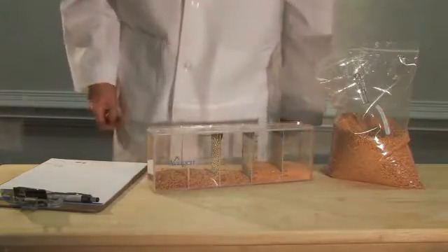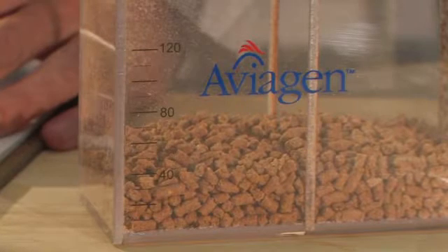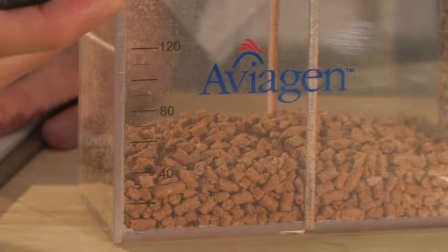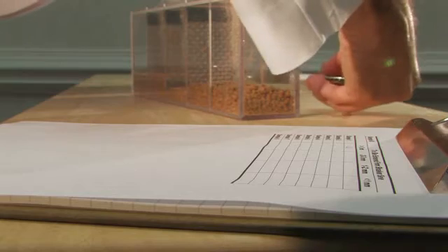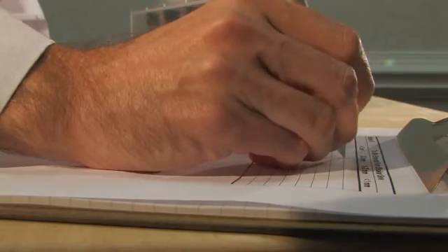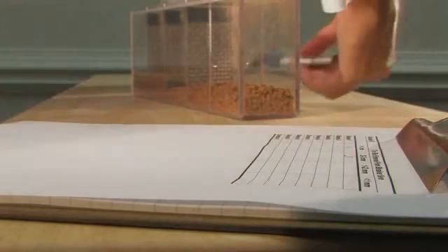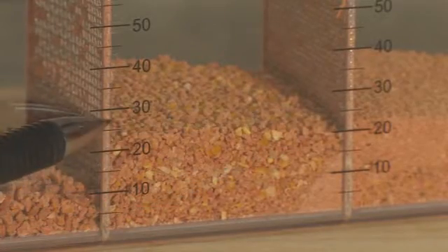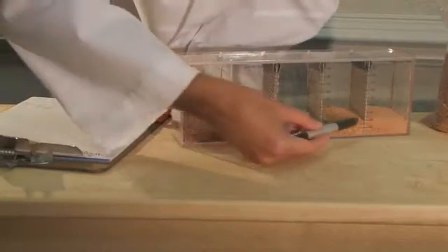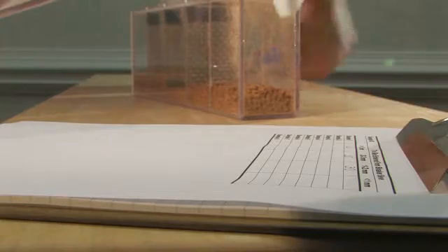After one minute, stop shaking the sieve. Return the sieve to a sideways position so that the numbers printed on the side of the sieve can be read. Ensure the feed particles are level within each compartment before recording the measurements. Next, read and record the values indicated in each compartment using the measurement scale on each compartment. For the particles greater than three millimeters in the first compartment, use the values of the left-hand scale. For all other compartments, use the values on that compartment.